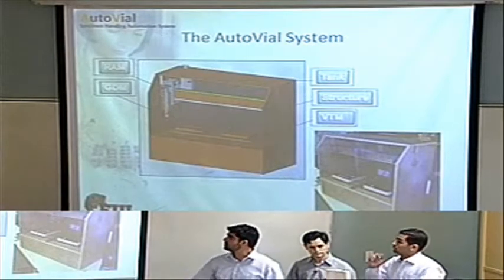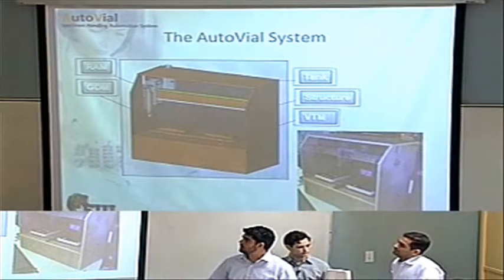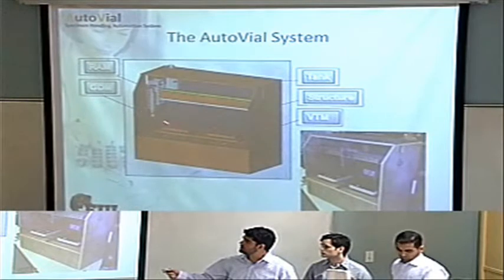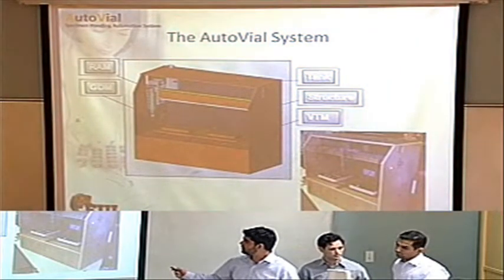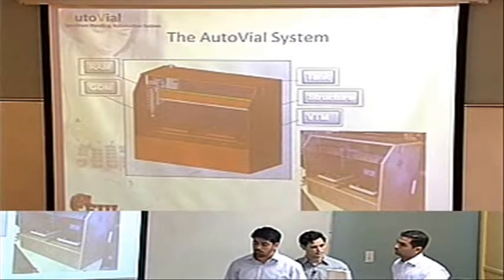Here we have the AutoVial System. This was our original SolidWorks model before we started designing. Here you can see the RAM, the GDM, the VTM, and the tank system and the structure. This is our final product, after we designed it.